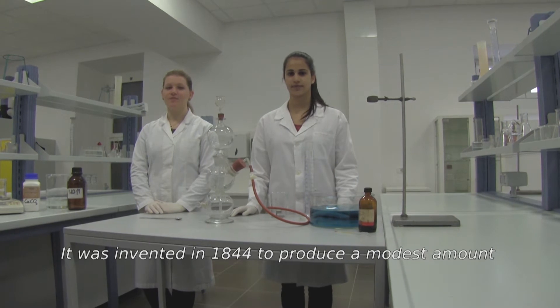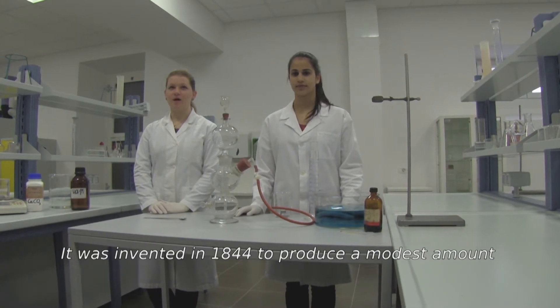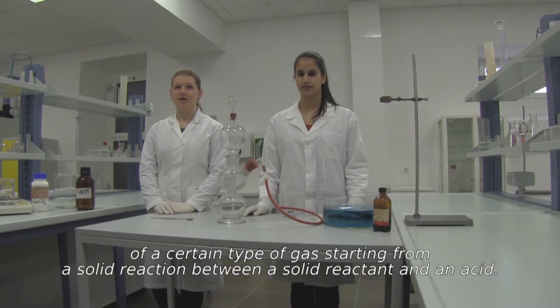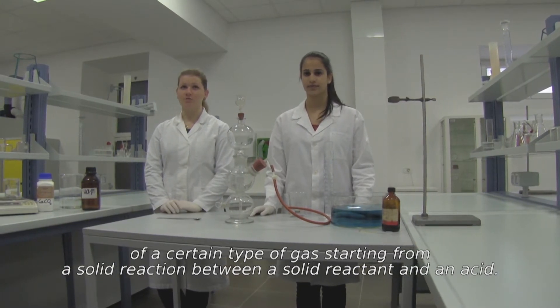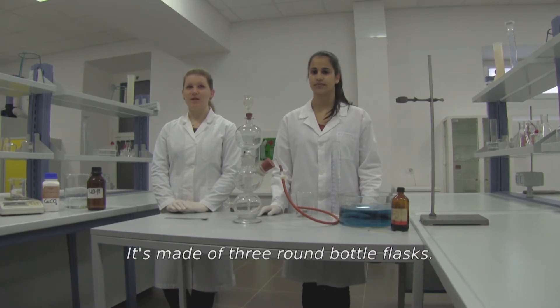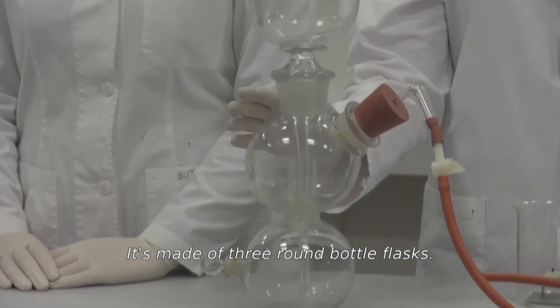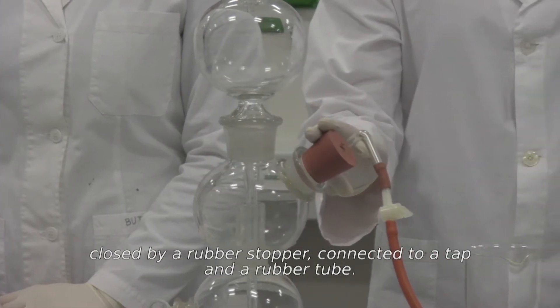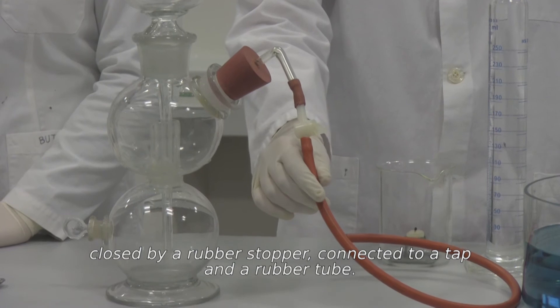It was invented in 1844 to produce a modest amount of a certain type of gas, starting from a solid reaction between a solid reactant and an acid. It's made of three round bottom flasks. On the second one, there is an opening closed by a rubber stopper connected to a tap and a rubber tube.